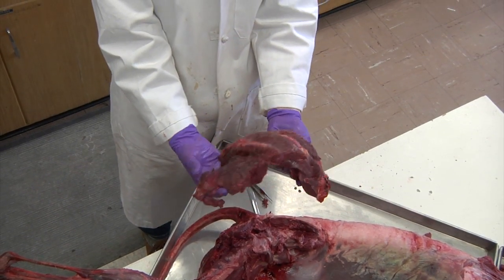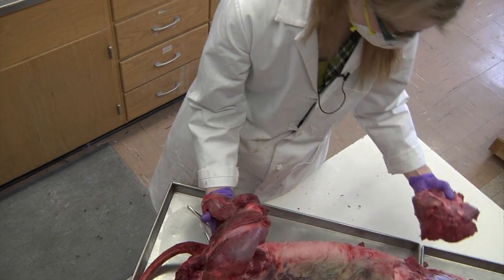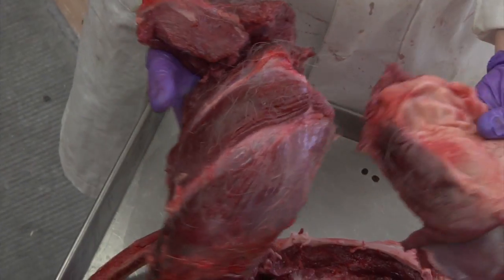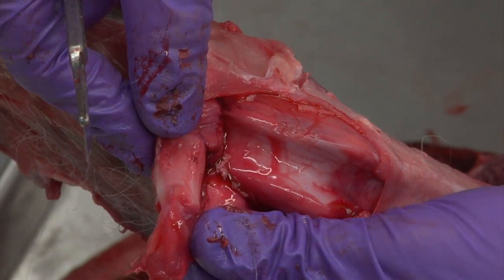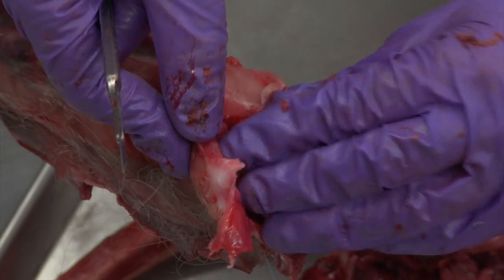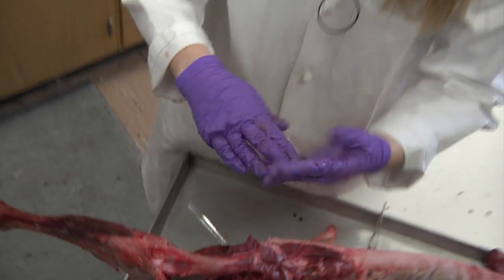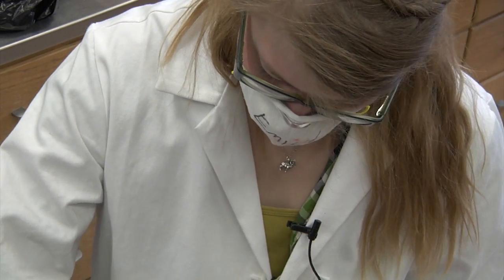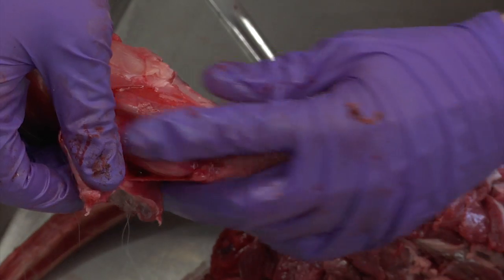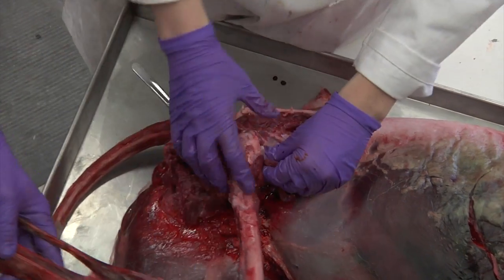Wow, look at that. This is just part of the muscle. This is all of the muscle that I have cut off of the femur so far — this is one leg, and this is not even all of the muscle. This is like three quarters of the muscle. The patella right here — this is your kneecap. It's pretty small, just this bone right here. There's a lot of cartilage that surrounds it, and this is extremely slick, very lubricated. The cartilage is that great material between your joints that helps everything move fluidly. So the patella sits right in there. This is the distal end of the femur — you can see how it moves in that groove, it's called the patellar groove.